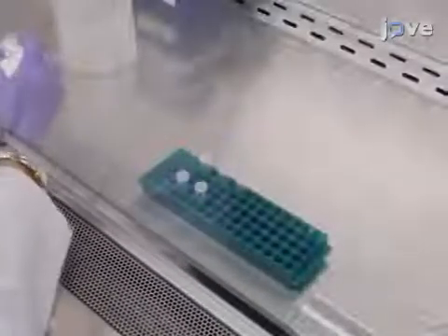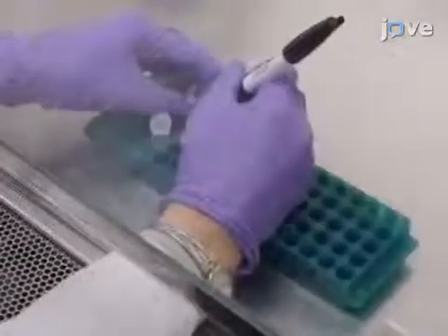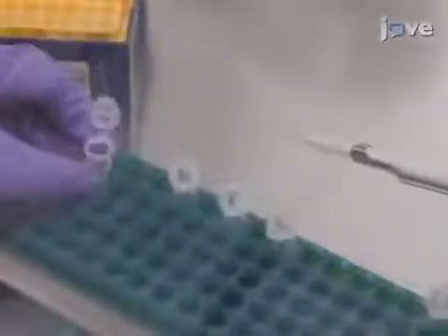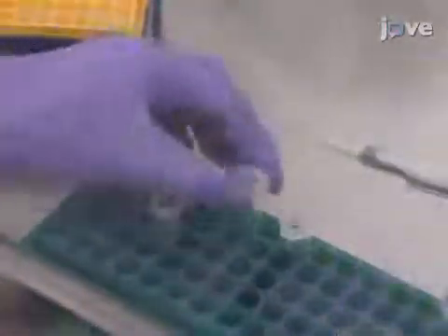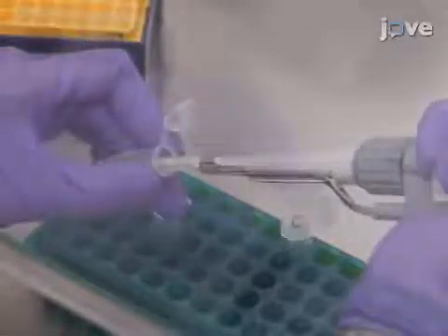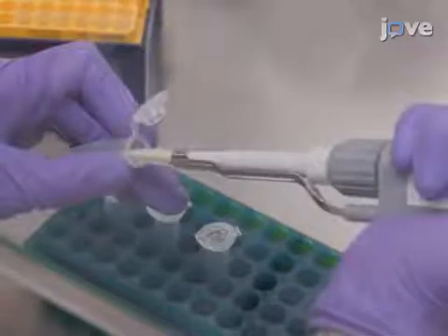Prior to treating the cells, pre-aliquot the needed drugs into 1.5 mL microcentrifuge tubes. For the competitor pre-treatment, add 4 µL of DMSO to each of two tubes, and 4 µL of 10 mM competitor to one tube.